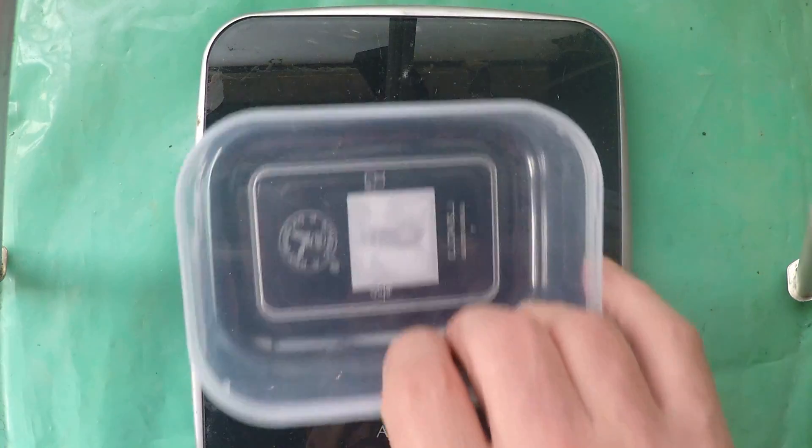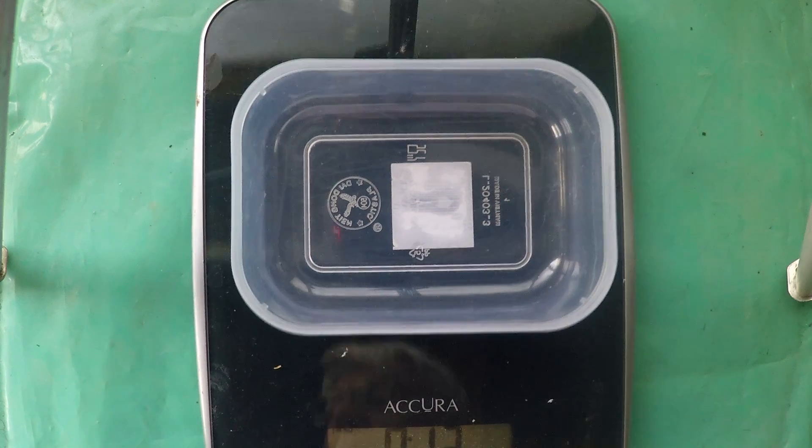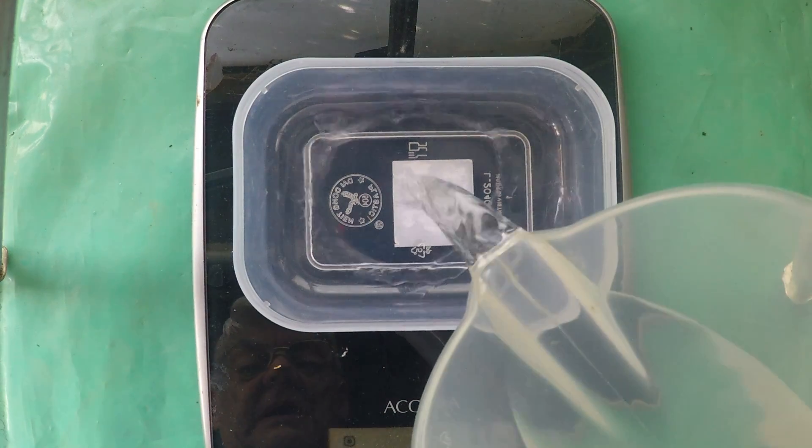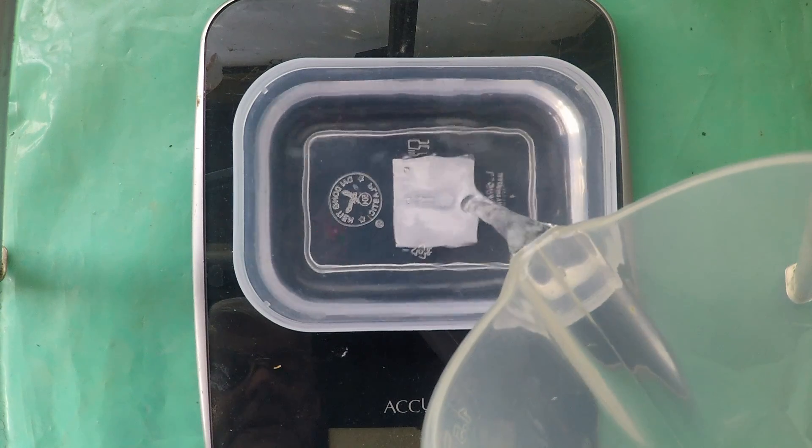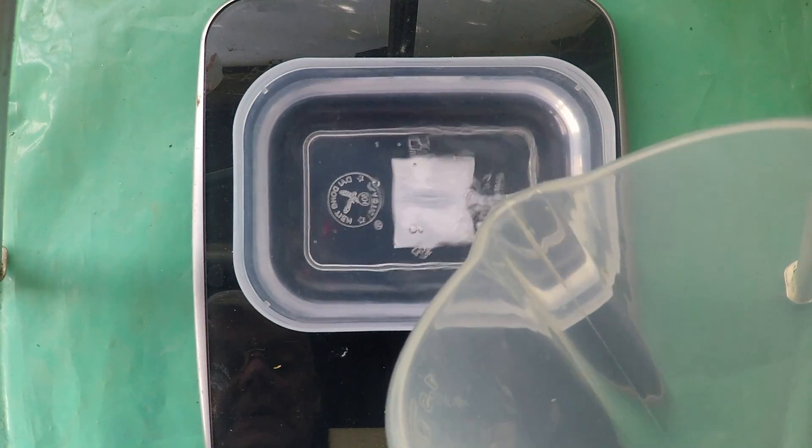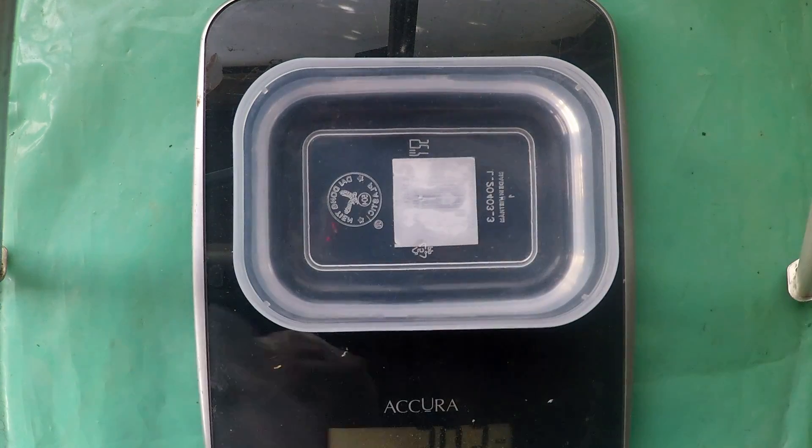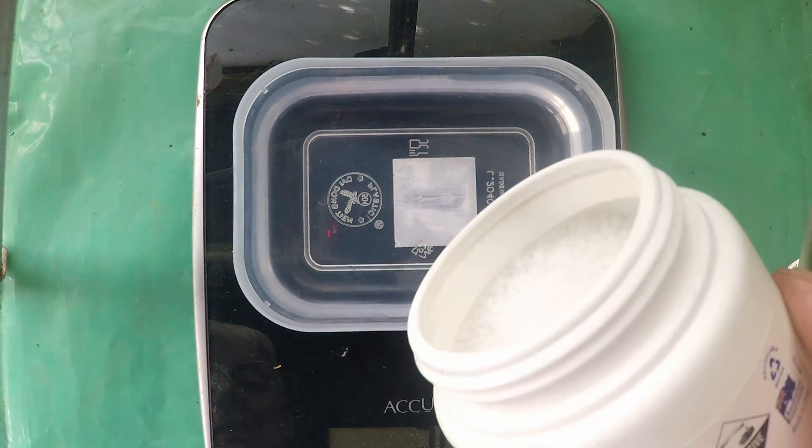Okay let's see what we can weigh up here. Start off with a bit of water, 300 ml of water. I want about a 20 percent caustic solution so more or less 60 grams of caustic soda.